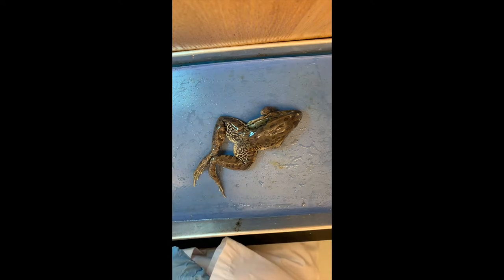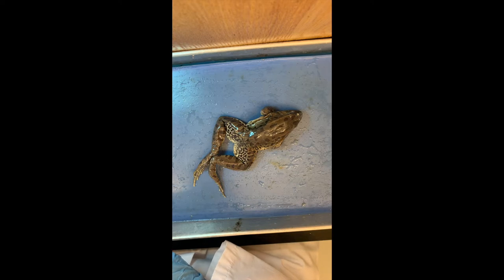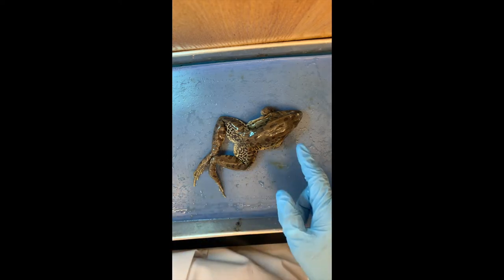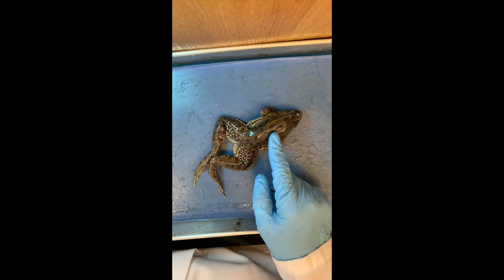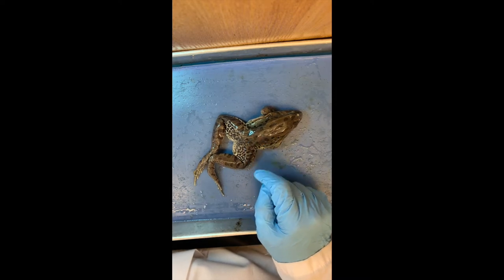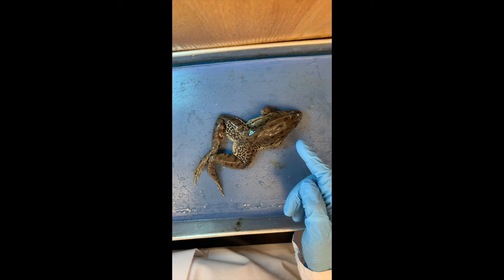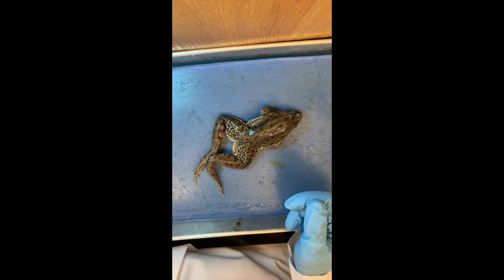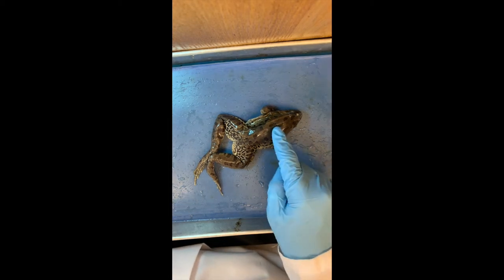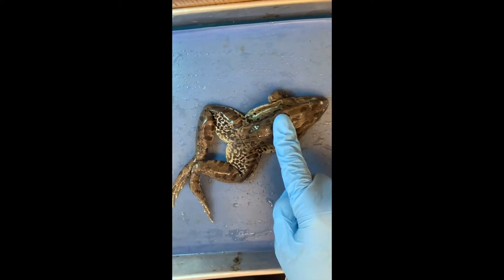What group of animals are we in today? Amphibians. Amphibians are usually characterized by a moist skin because they use it to breathe — they breathe through their skin. They do have lungs too, but the lungs are not too great, so the skin compensates. And I can feel it a little bit here — they have a backbone.